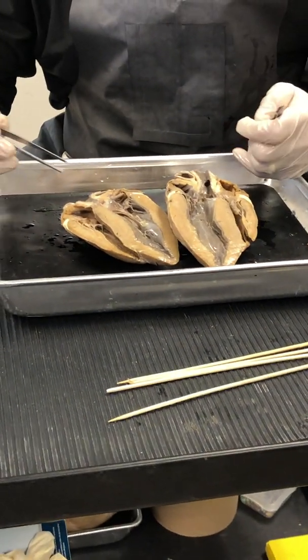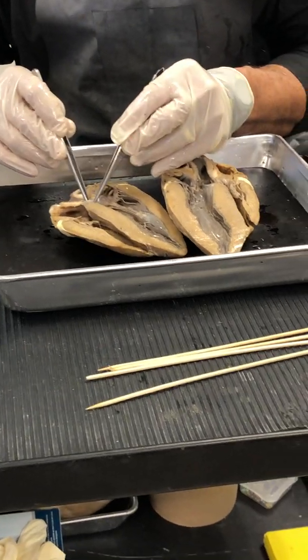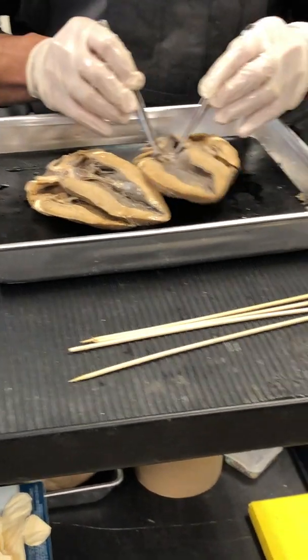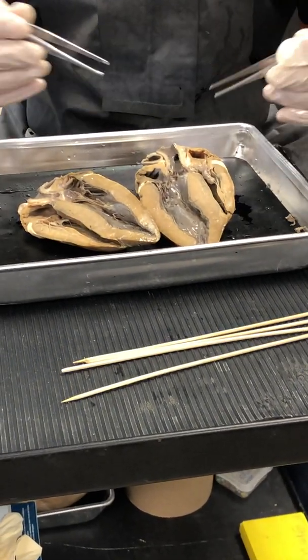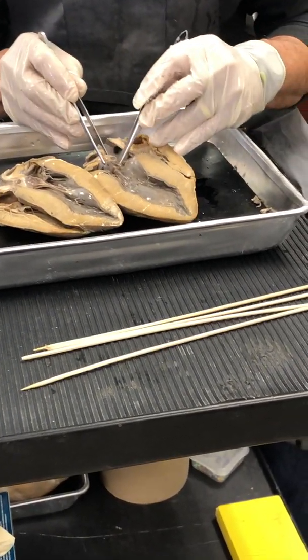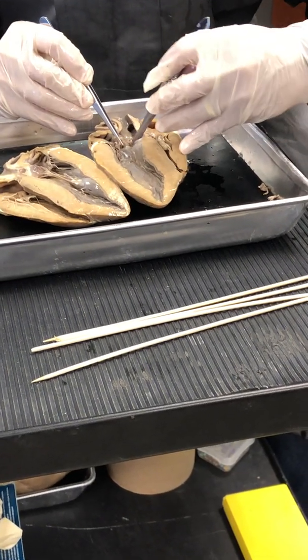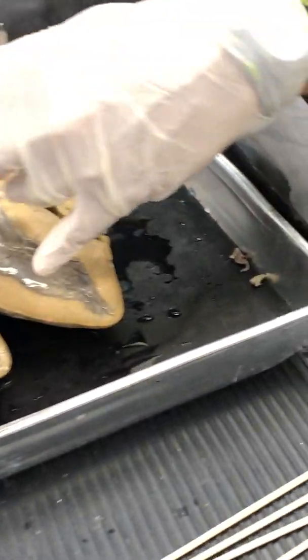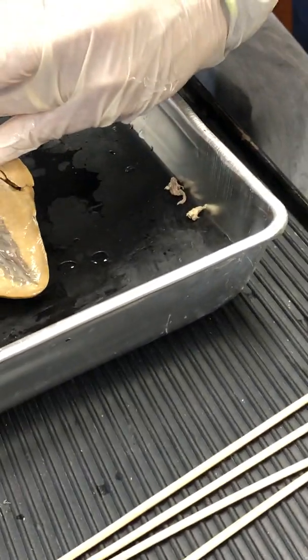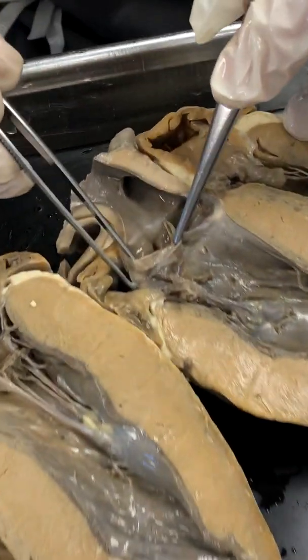Now, folks, let's come around here so you can see what you need to draw in. So now I'm looking right. So notice, where am I looking? I'm looking right. As soon as you pass the aortic semilunar valve, you are going to look for the opening of the coronary artery. So that diagram that we have there on that figure 26 point whatever I had asked you to draw to find is the coronary artery opening right there.